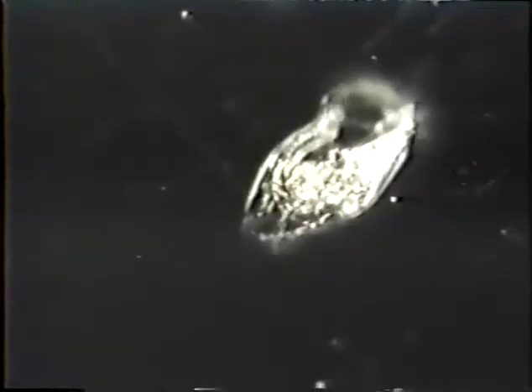This is a few minutes later. As you can see, the interior of the organism somehow has changed its composition and refractility to the light. If you watch closely, you can see the flagella up around the mouth parts start to beat asynchronously and, in fact, actually stop beating.